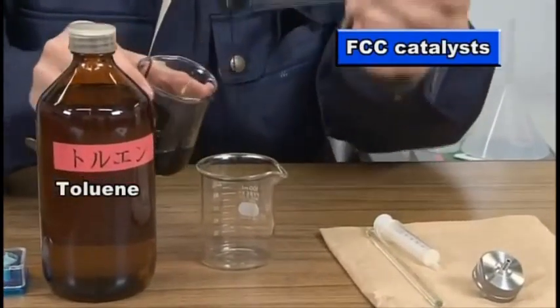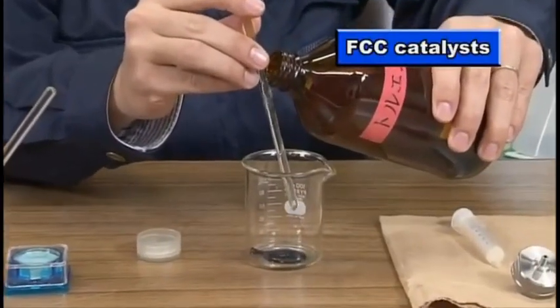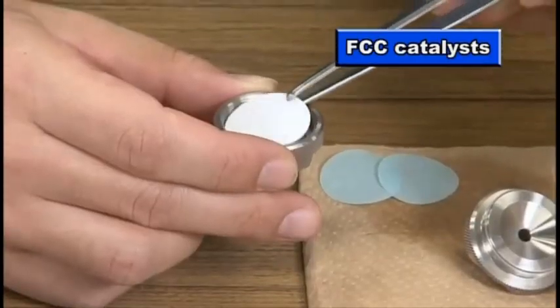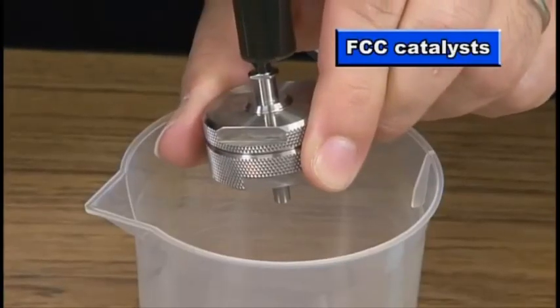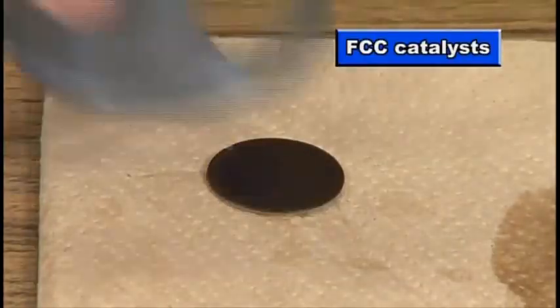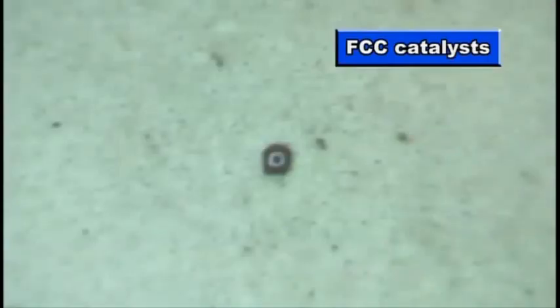Check for the presence of fine particles of FCC catalysts. Filter the sample oil and then use a microscope to observe the trapped FCC catalyst particles and count their number. Based on this number, estimate the content of FCC catalysts.